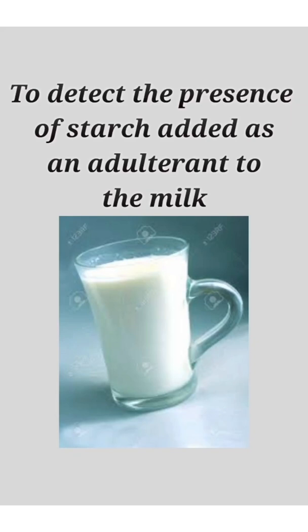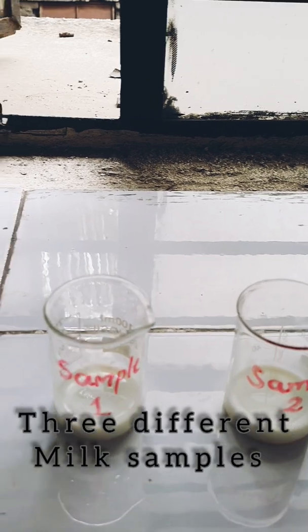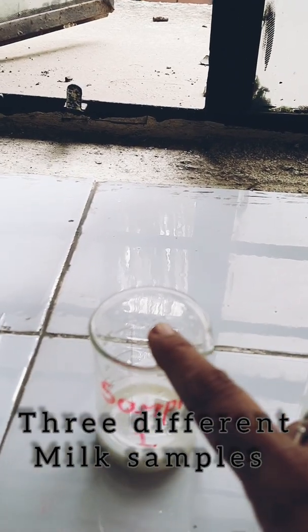Hello students, today we are going to detect the presence of starch added as an adulterant to the milk.